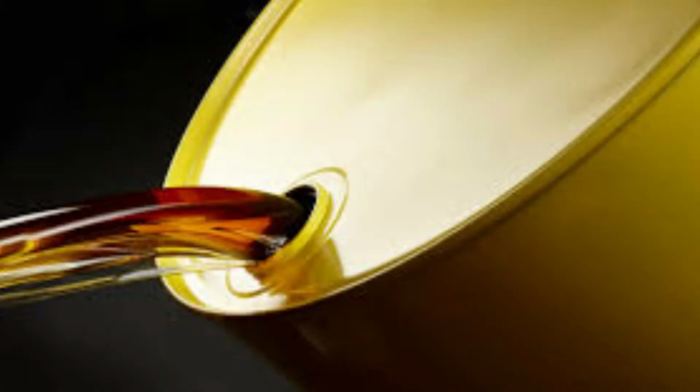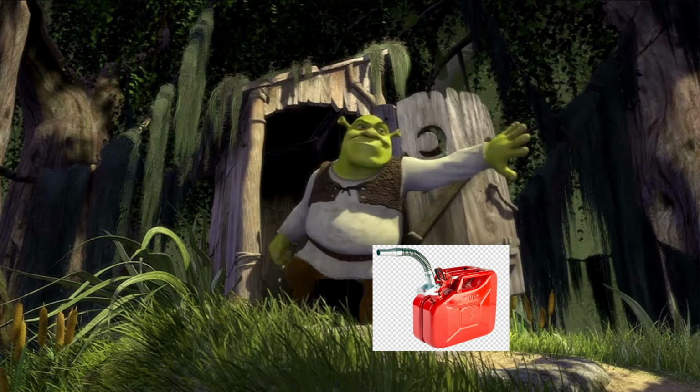You might ponder a few uses for a separating funnel, such as separating water from oil, kerosene, and gasoline. The most obvious use is that you can just reuse these resources individually, so that you don't have to get new sources of water, of oil, of kerosene, of petrol, and stuff like that.